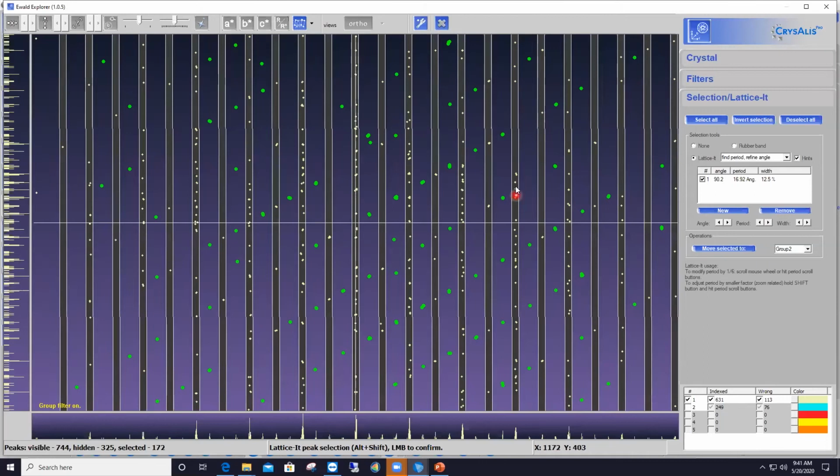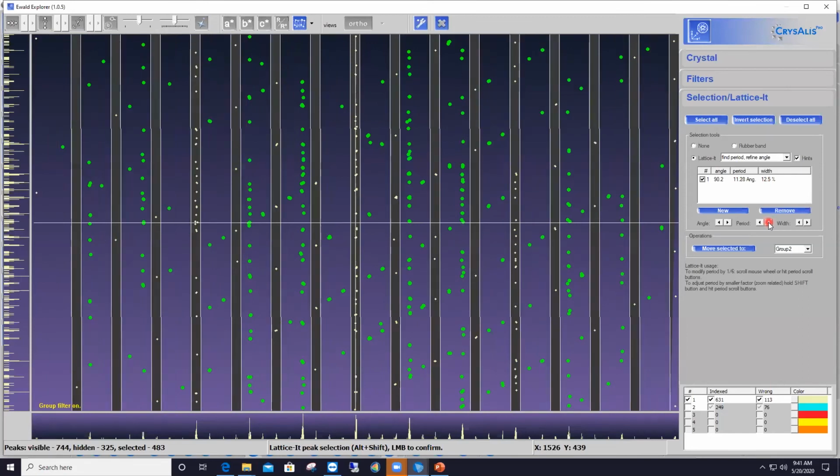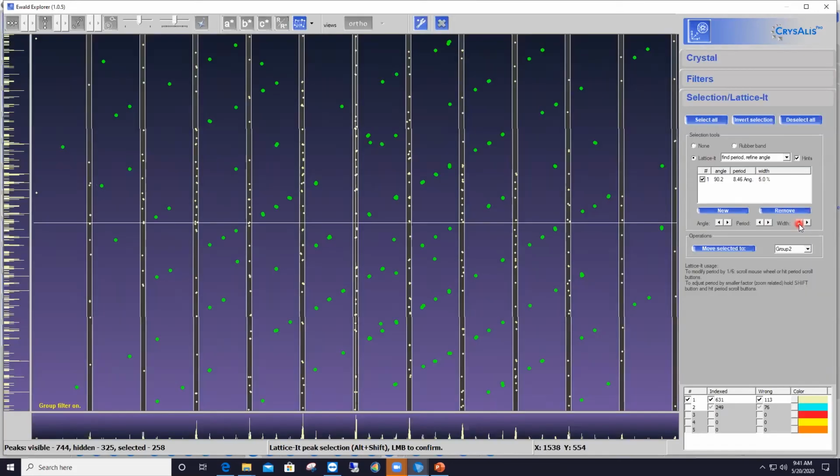Here I've got that row selected and that row selected, only one intermediate one. And then I keep going, increasing the period in between rows, and keep going some more. And there it is. Now I've got all the fully populated rows of reflections properly selected, and nothing in between. So you see also that the bars have become a little bit larger, so I can certainly decrease their width by clicking the left pointing arrow button here to make those bars a bit thinner.